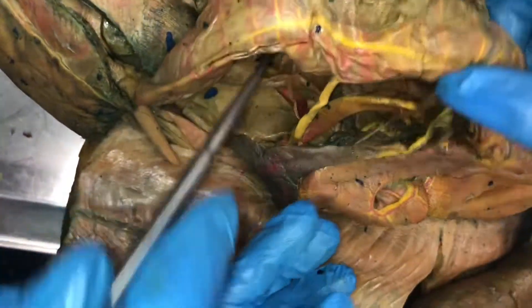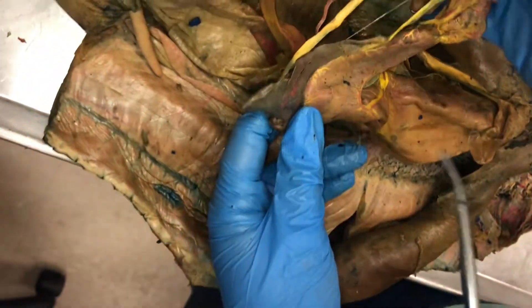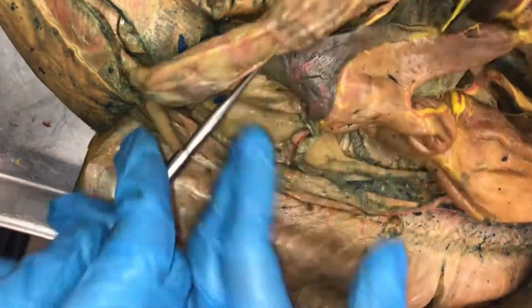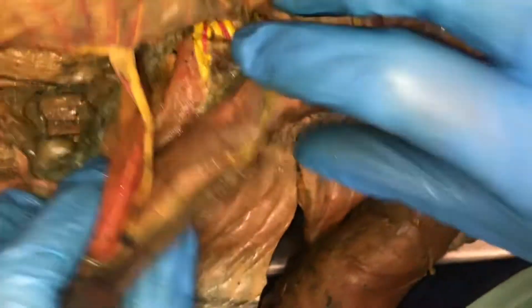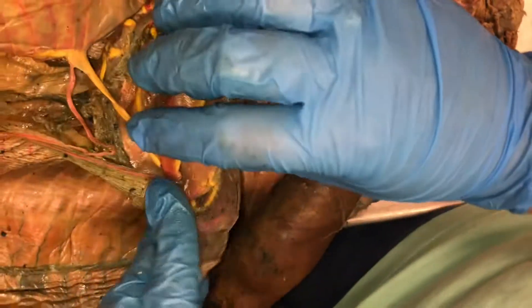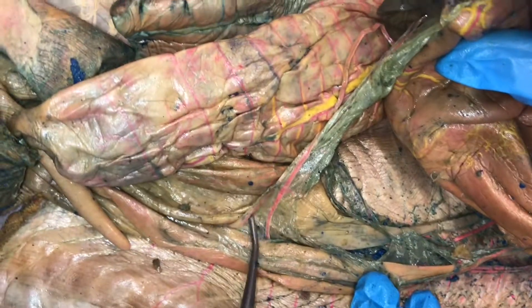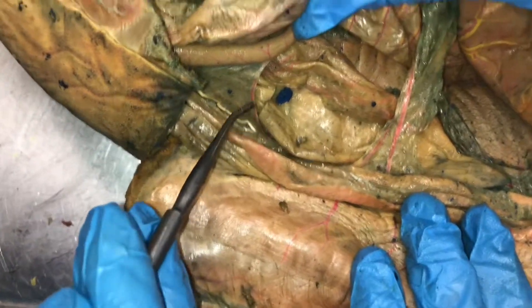And then we just have the anterior mesenteric. You have an anterior mesenteric artery as the first branch and a gastrosplenic artery as the next branch. And then down at the bottom you have a posterior mesenteric artery connected to your rectal gland.